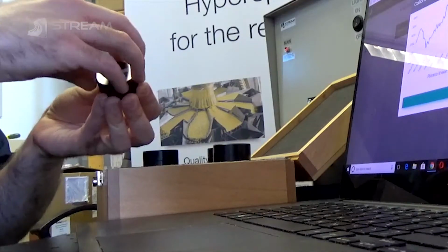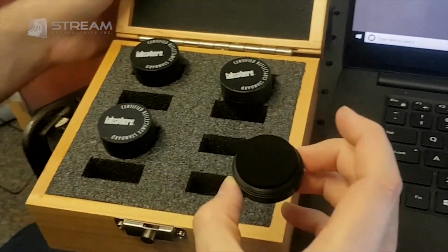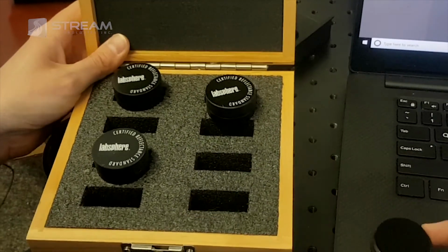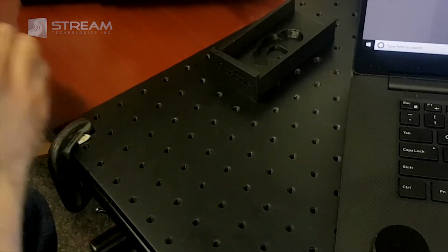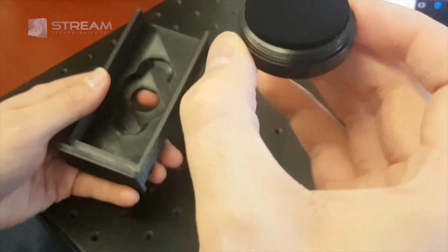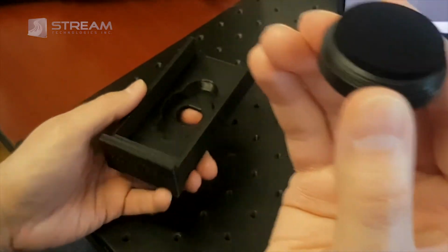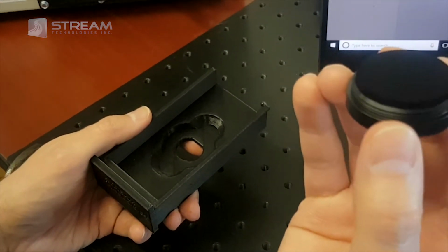They're a little screw-on tops, so just take them out like that. You can see this one's a 2%, so that means it only reflects about 2% of the light back. Oh, make sure with these reflectance standards that you don't touch the reflective surface. This is because once they start getting dirty, they'll basically change their reflectance values. If you get some dust on them, you can clean them off with a bit of dry air. Don't blow on them because that'll just get moisture on them.